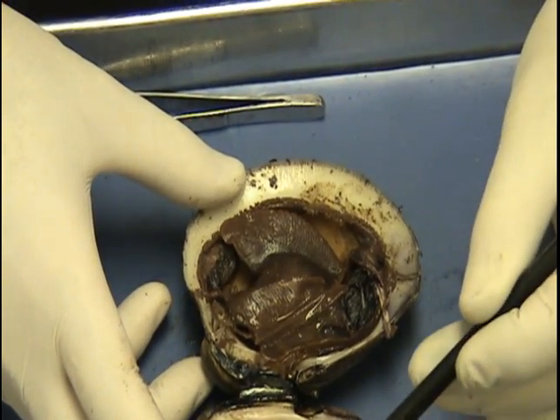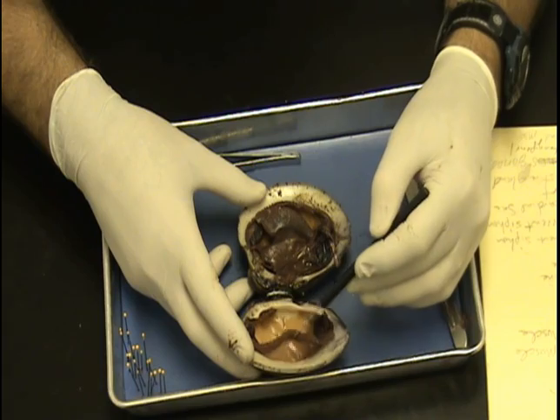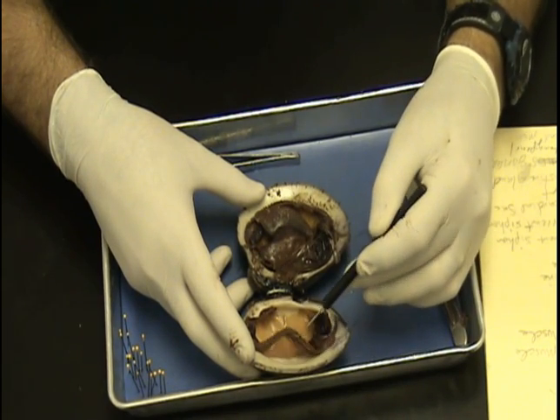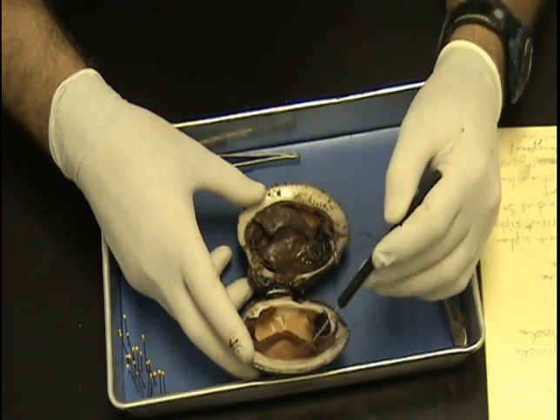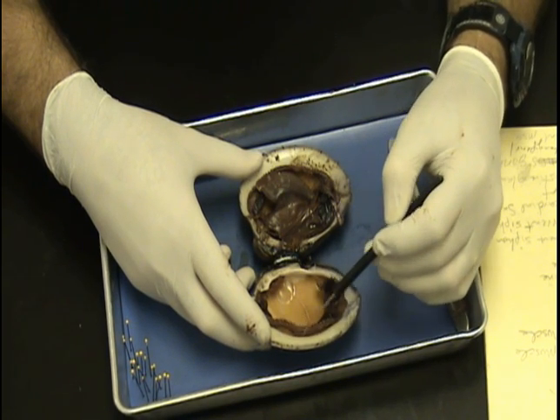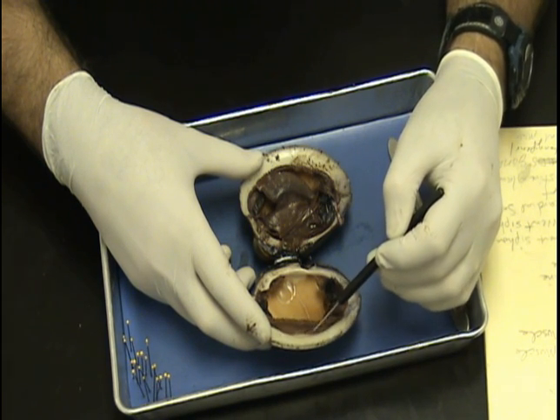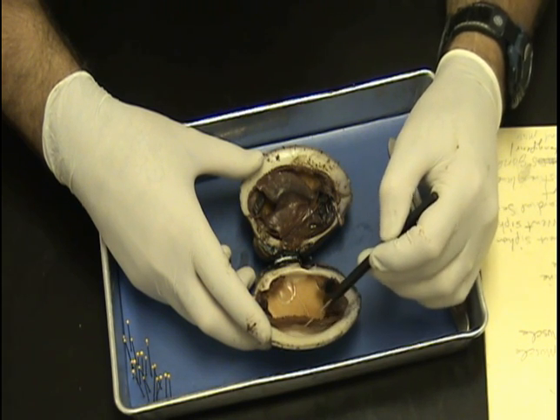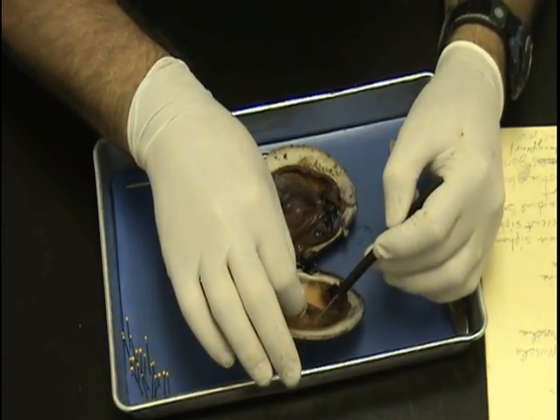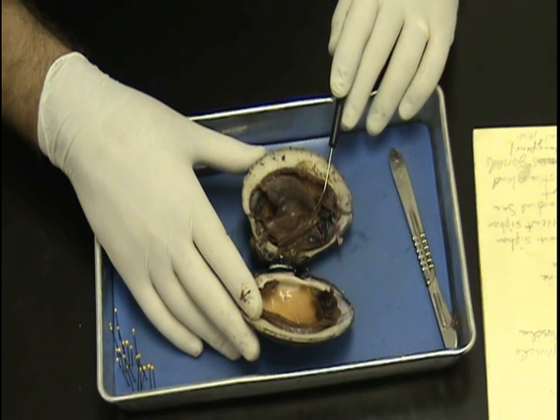Mantle — the mantle is this right here, that lines the valve. The mantle actually is what makes the mother of pearl. The mother of pearl is the light color that lines the valve. When a clam makes a pearl, it's because a little piece of sand or grit gets in the valve, causes irritation, and the clam secretes mother of pearl around that sand grain to form a pearl. For a cultured pearl, they pull back the mantle, put a little plastic bead in there, and the mother of pearl is built around it.